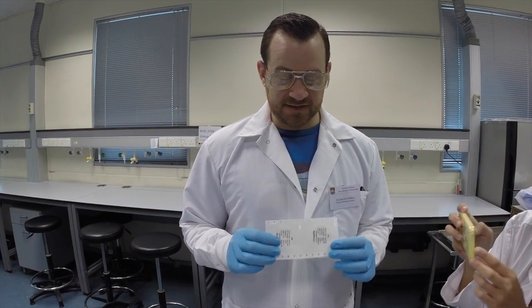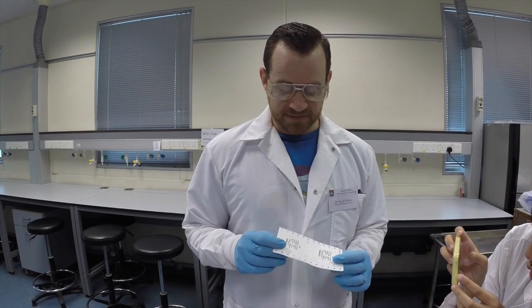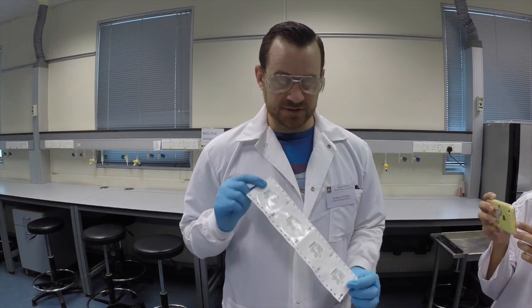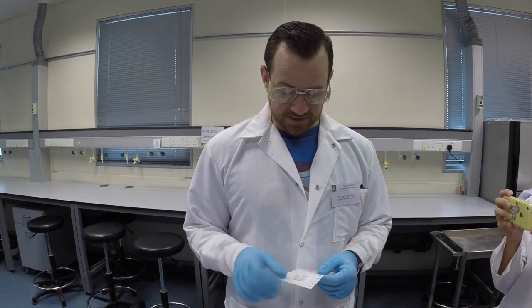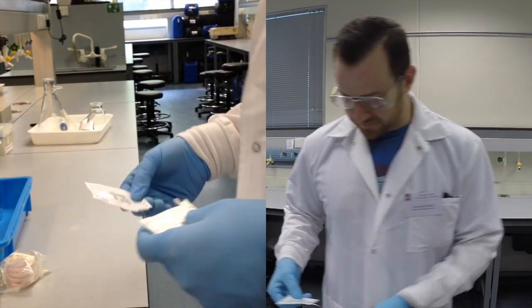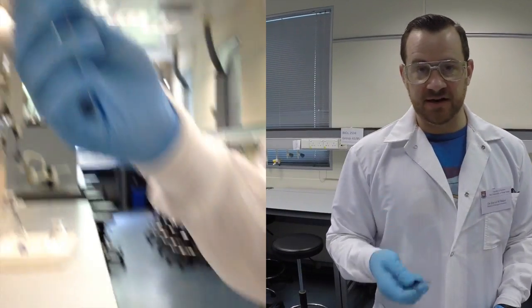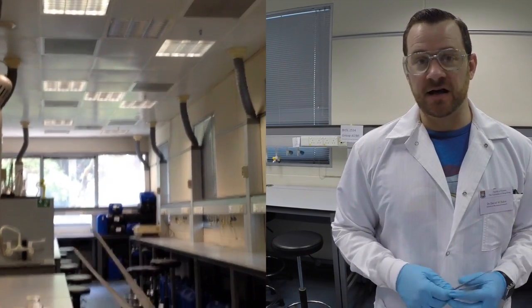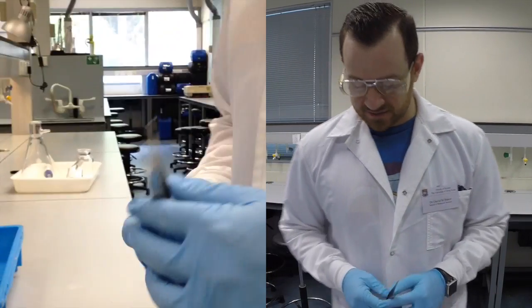So unlike with total suspended solids, we're now using a membrane filter that's made out of a polymer, not out of a glass fiber. And you'll notice that each of these filters is wrapped individually in a sterile packaging. So there are no microbes or contaminants inside these packages. So I can tear off one of the filters, and I should have with me a pair of forceps. Now, there are other people in this group, in this class, who are going to be using these forceps for Enterococcus. So we're going to dip these inside ethanol to make sure that they're sterile.